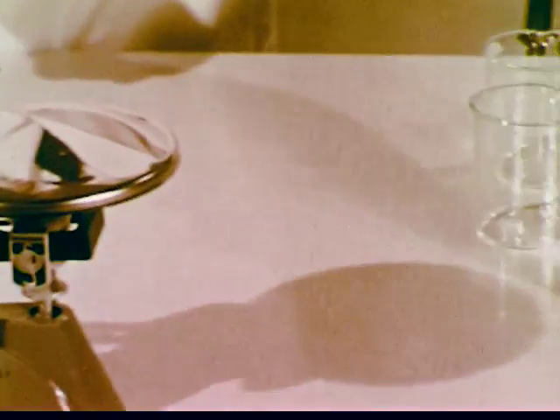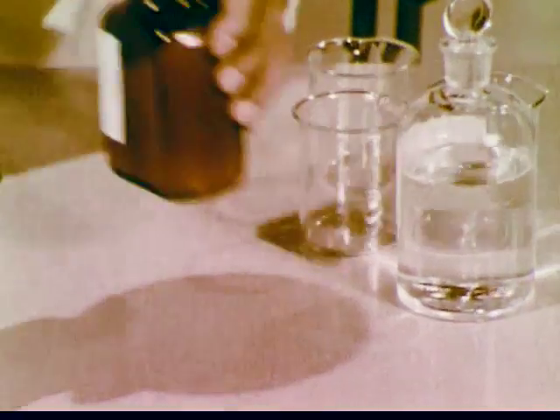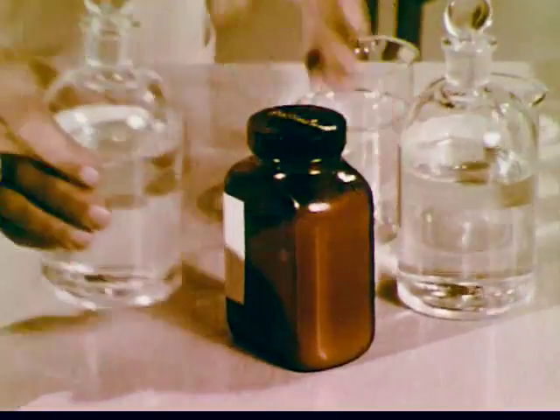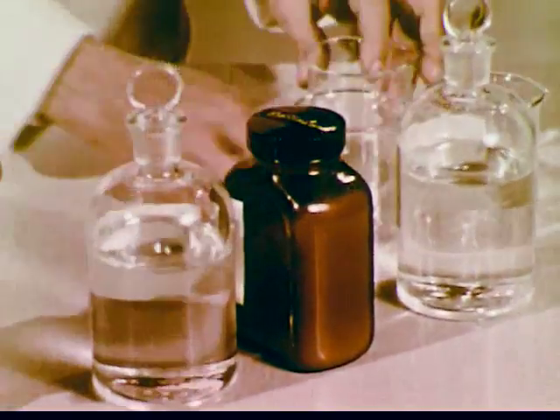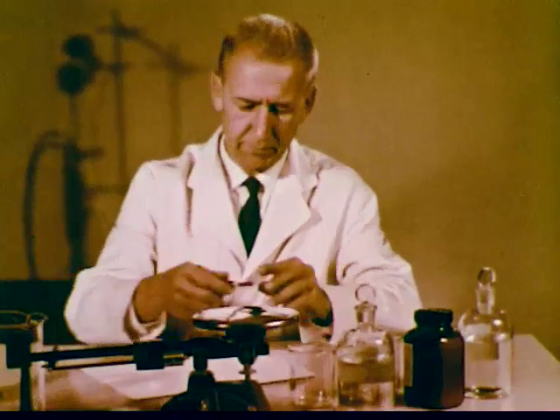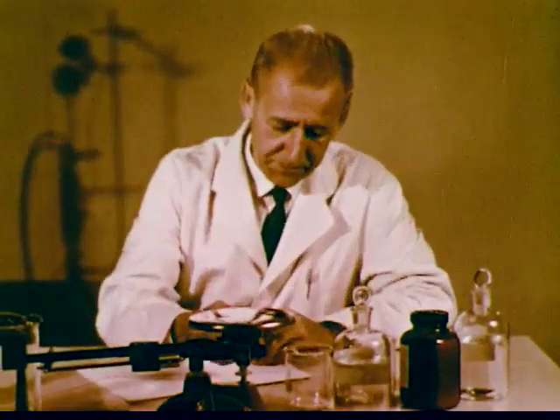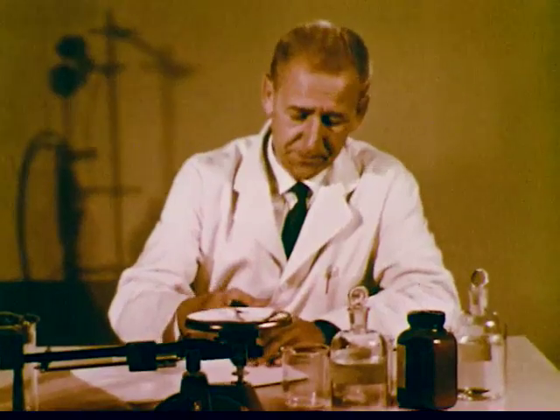To prepare for the synthesis, the apparatus and the reagents are assembled. But how much of each reagent will be needed? To find out, we first write a balanced equation for the reaction.